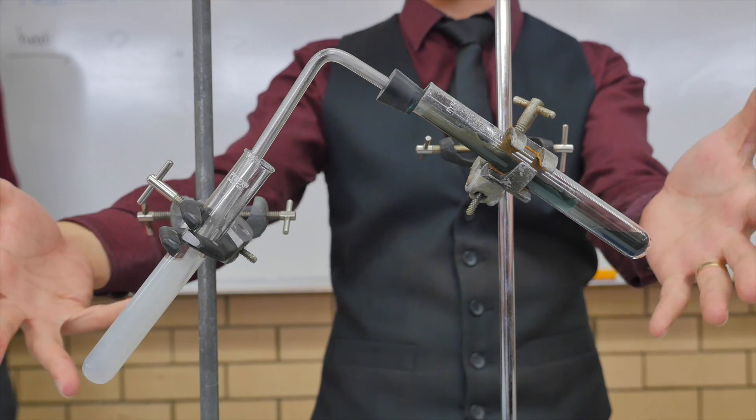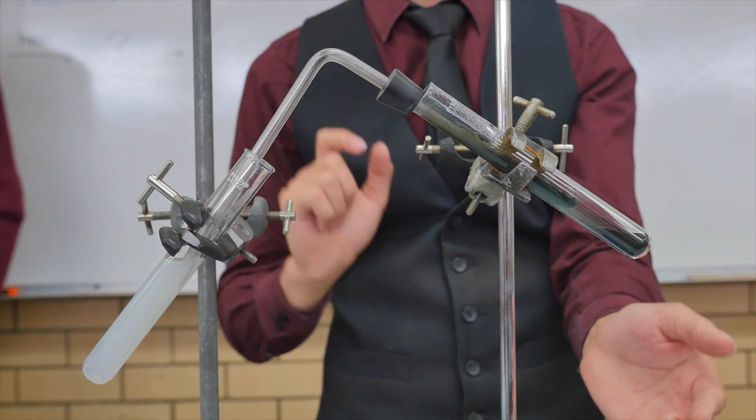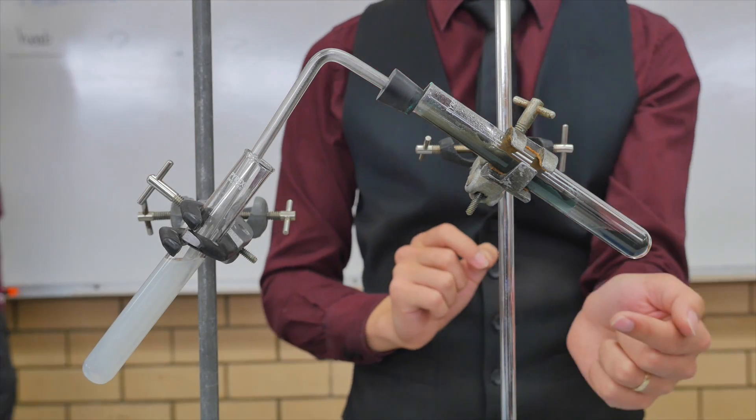Shrink. Well, they come together, so it actually starts to suck up the liquid through the pipe, and then down into here, which is not what I wanted, because I need to dispose of this.